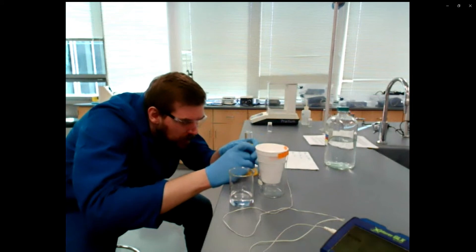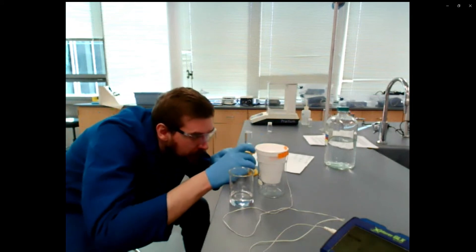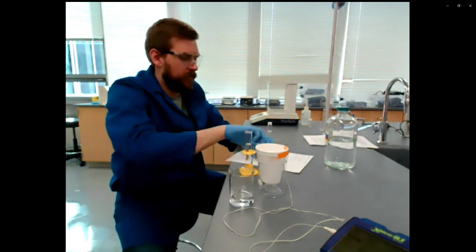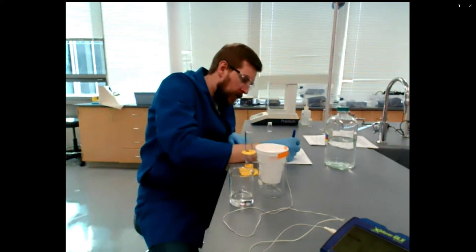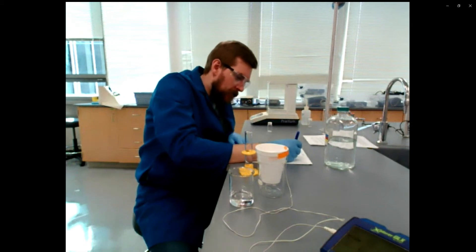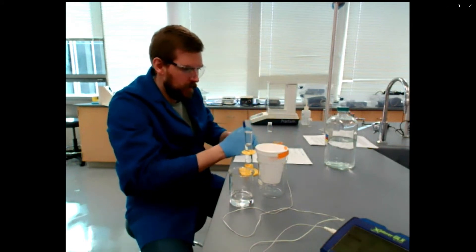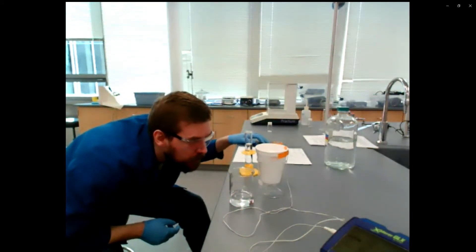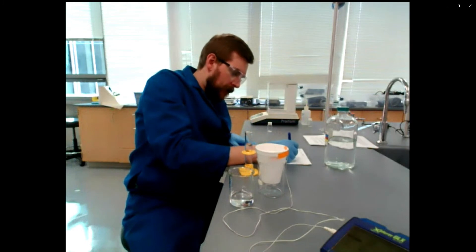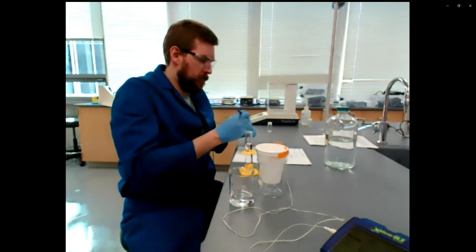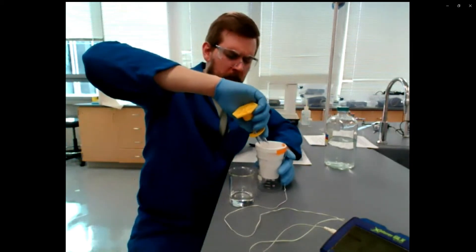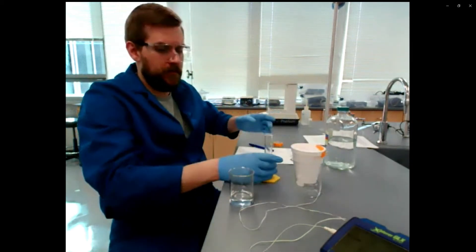It doesn't have to be exactly 50 milliliters. Just somewhere close, within a milliliter or so is fine. But I think I measured 24 and a half milliliter and then like 24.8 or .9 or something. And then just sum them together to figure out the total volume of aqueous one molar hydrochloric acid. So that's what I was recording there. So add one graduated cylinder's worth and then do it again.